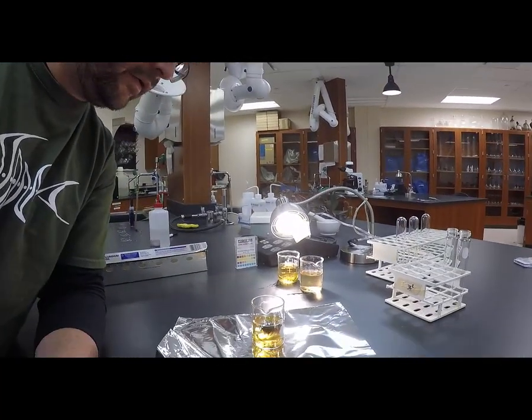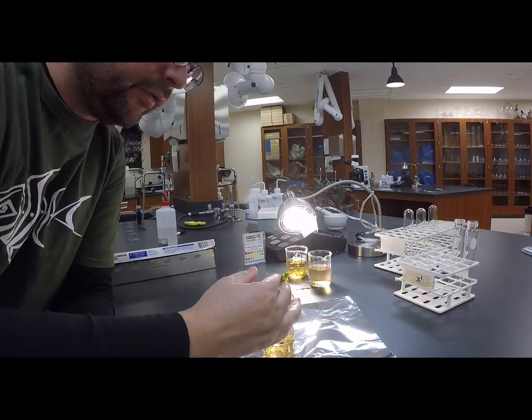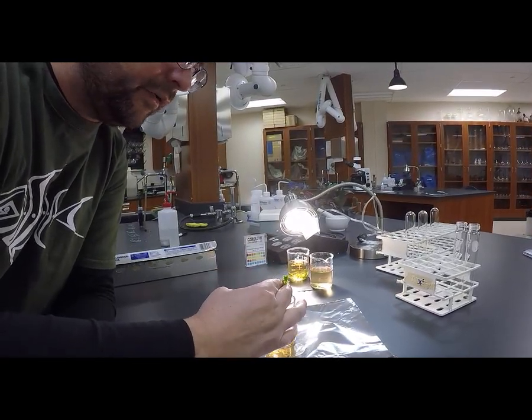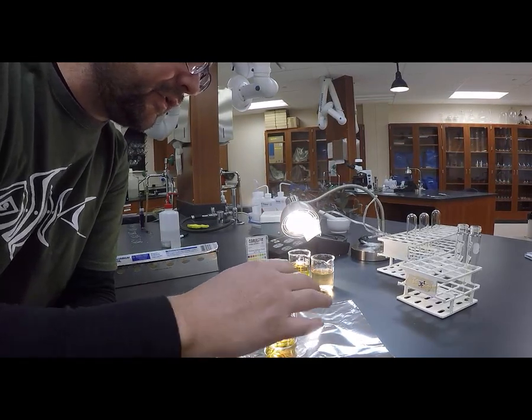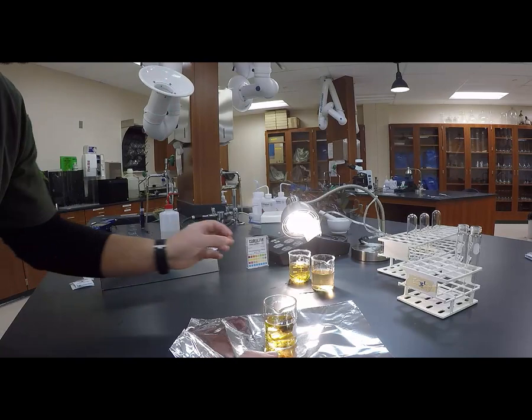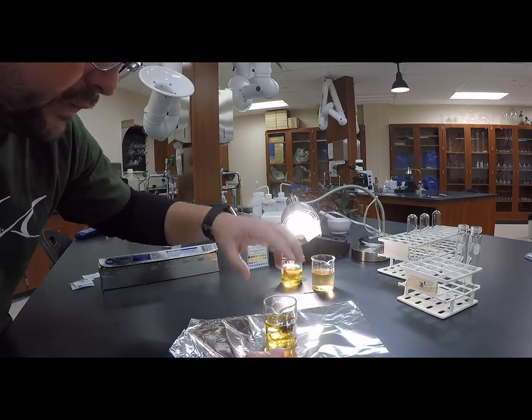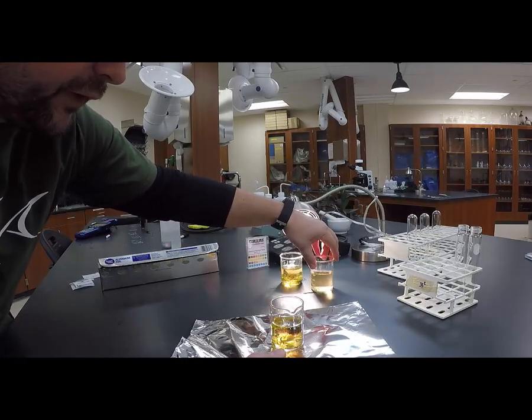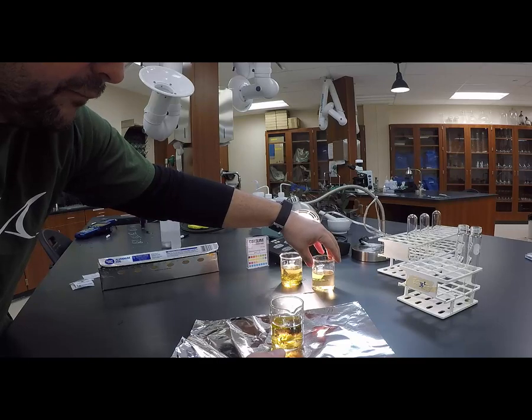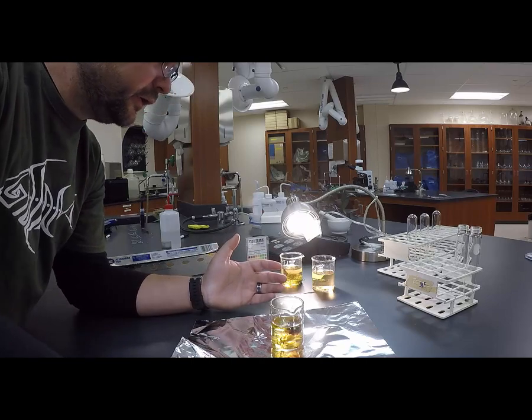Okay, I'm back and I got the plants in. So this is Elodea. You can see the green on that plant. That means that there's chlorophyll in there and it should be able to do photosynthesis. I got about 10 centimeters of plant in both Beaker A and Beaker B. And then Beaker C is empty. There's nothing in there, so there should be no photosynthesis going on in Beaker C.